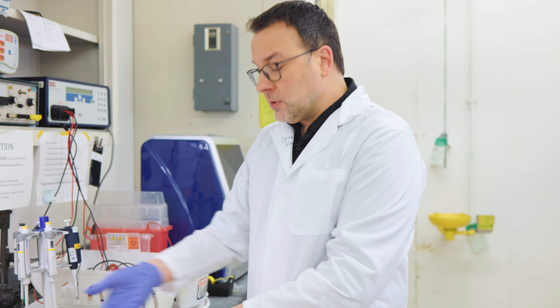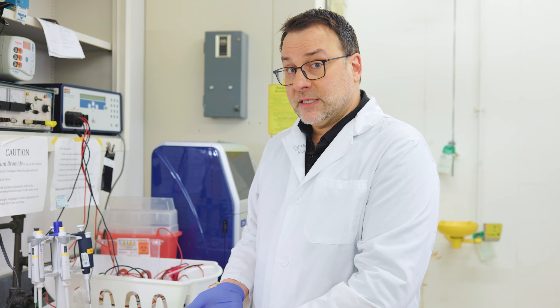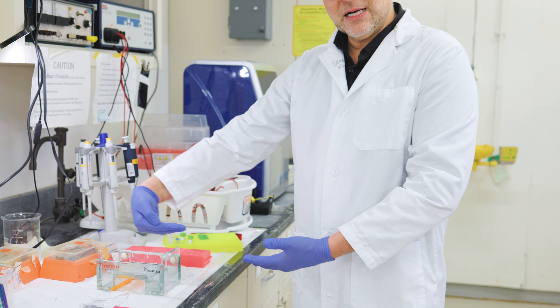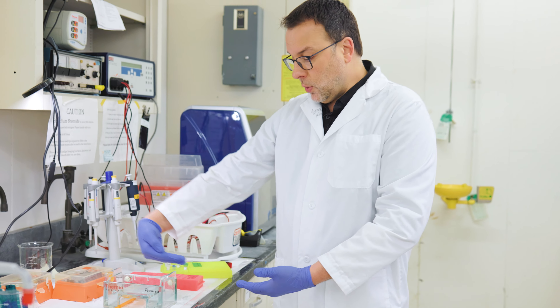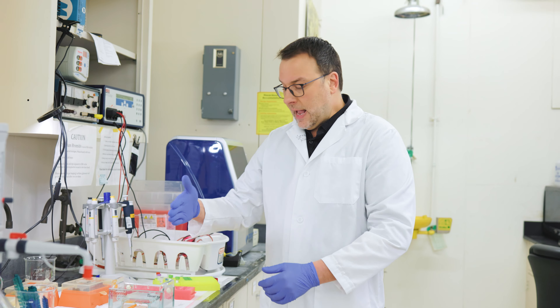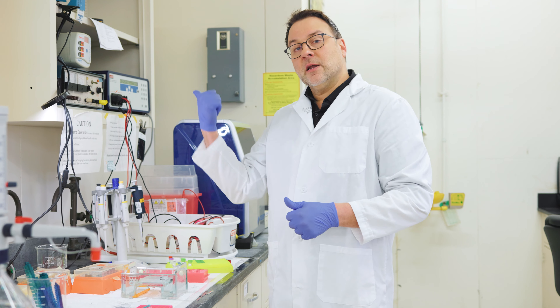What I'm doing is what we call running it out on a gel — putting the DNA in there and running an electrical current. Since DNA has an electrical charge, it moves towards the positive pole and will run out in a little band. If everything worked, there will be a single strong stripe in each one of these lanes.